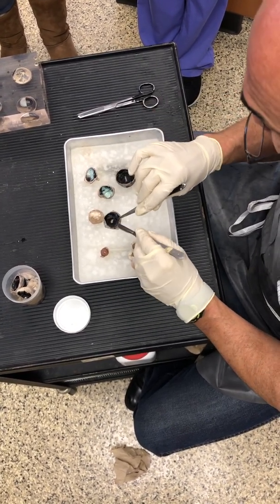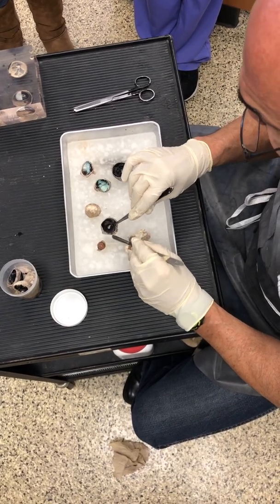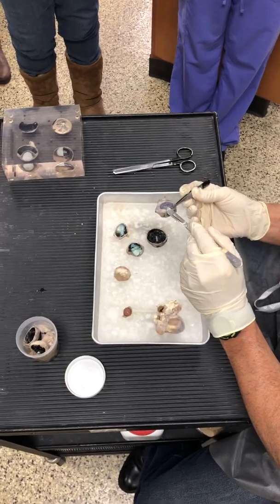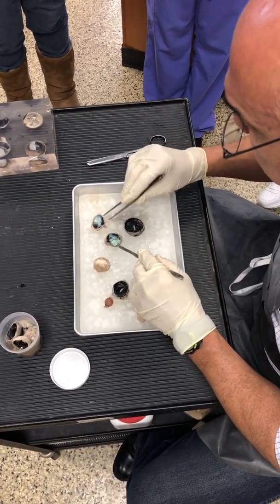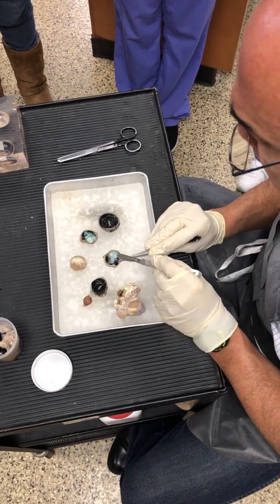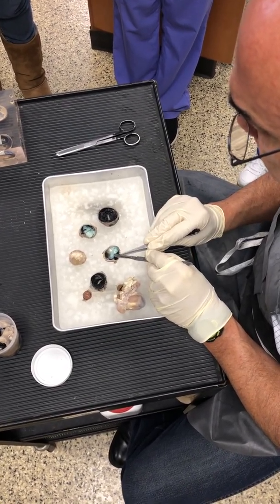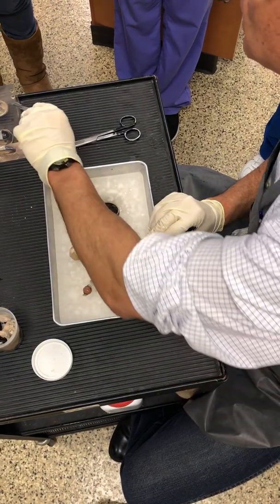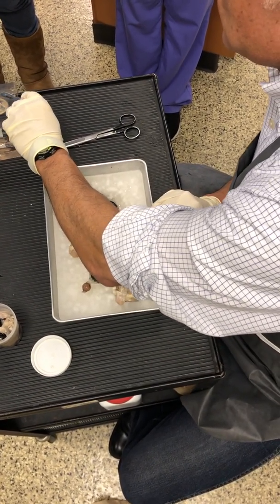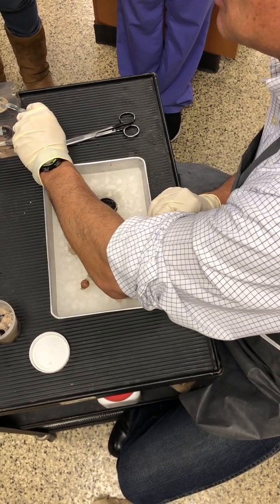So that is the back of the eye, the pigmented part. We saw the cornea, we saw the pupil. And then here we see this iridescent layer, which is on the sheep. It's called the tapetum lucidum. You can see that eye, which again I'm assuming is a human eye. We can't see the tapetum lucidum there.